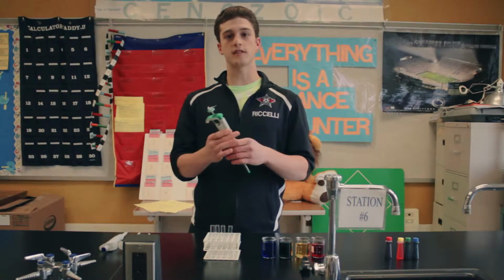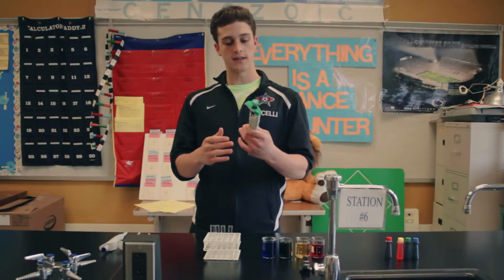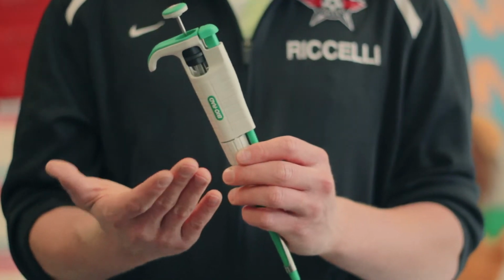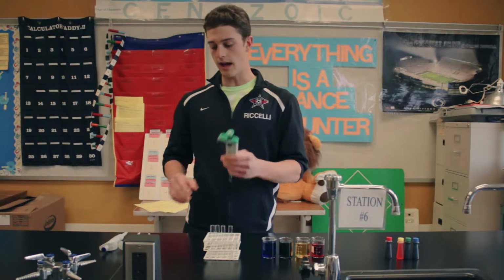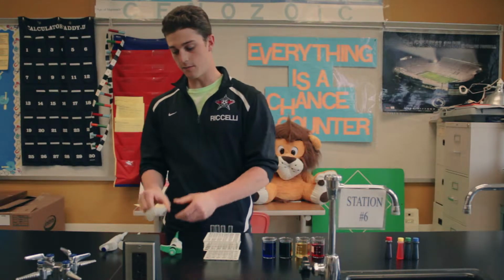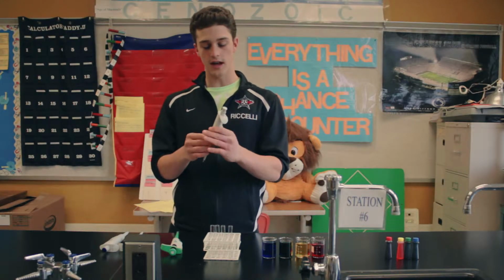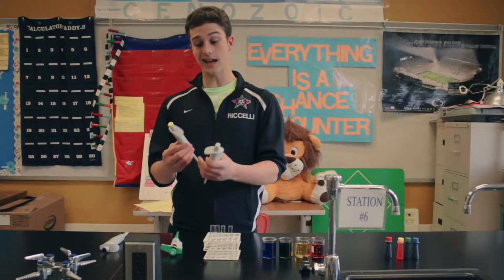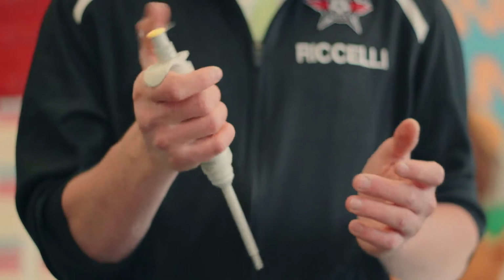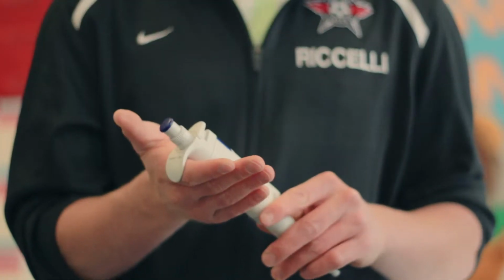So, in Miss Anselmina's lab, you're going to be using one of 4 different micropipetters. This is the BioRad micropipetter, and it measures 1,000 microliters. And then you have the more expensive, more accurate Eppendorf micropipetters. You break it, you buy it. This one's 10 microliters. The yellow tip one is 100 microliters, and the blue is 1,000 microliters.